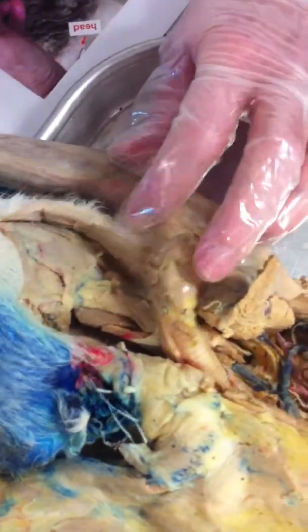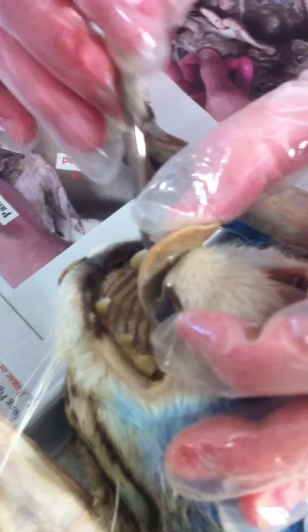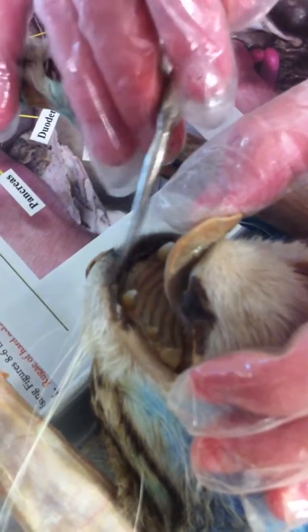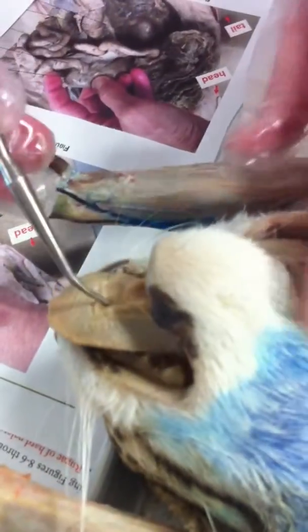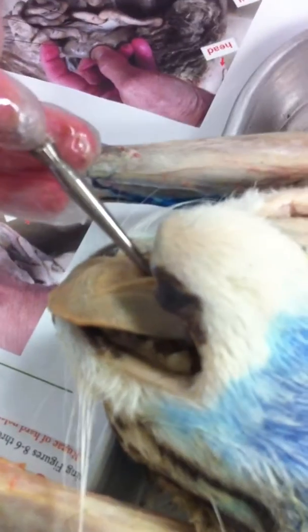All right. What we have is the top part, the ridges in the top part of the palate. Those are the rugae. Rugae means fold. Next, I think you have the oral vestibule. That's the space between the teeth and the gums, bottom and top. You know the teeth. You know the tongue. There's a little thing that holds the tongue down called the lingual frenulum, which is here.